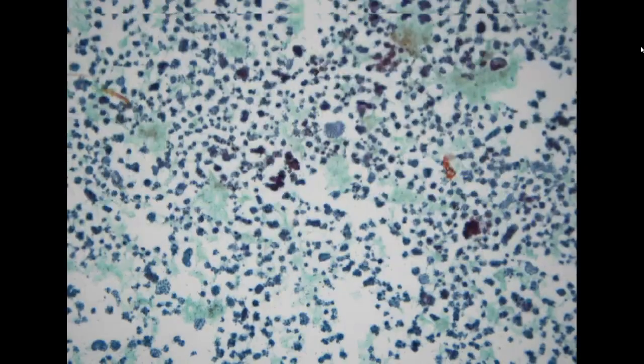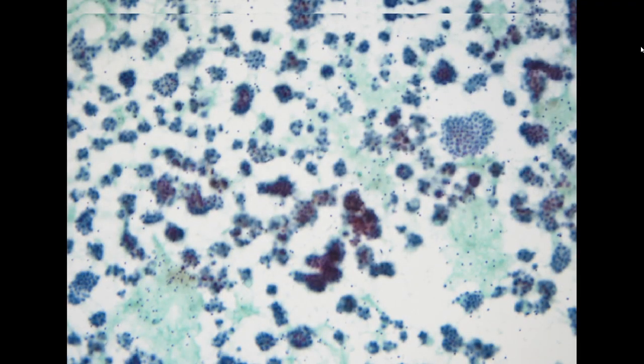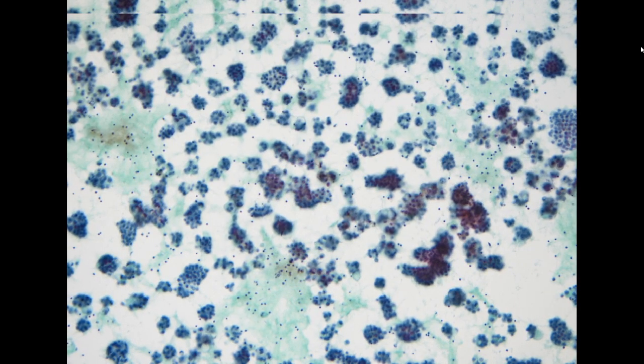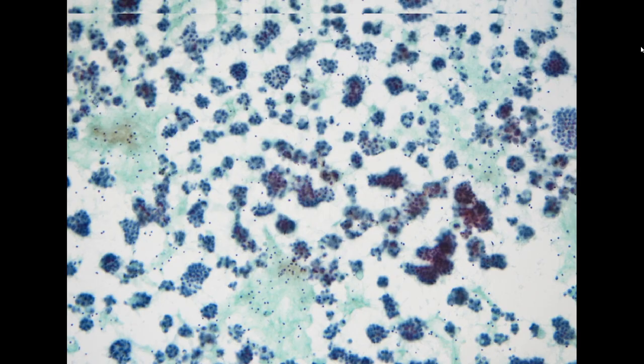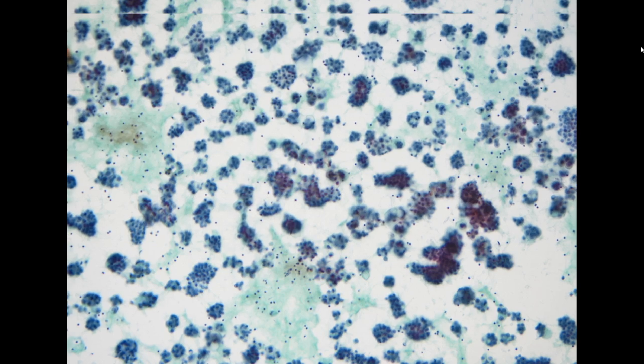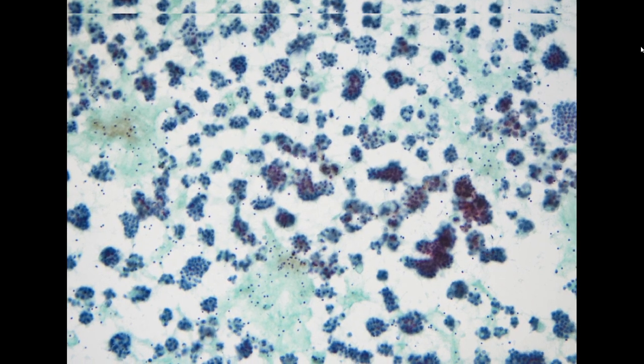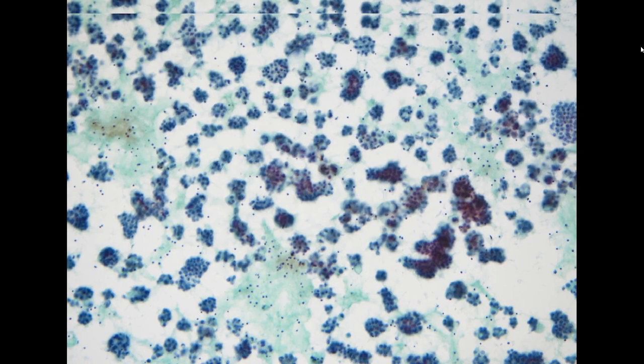So the next specimen, the patient is a 64-year-old female. This is a pleural effusion specimen, and the patient came to our emergency department. She is actually a new patient here. She only came to our hospital once and seems to have had a consult with a famous breast surgeon for a second opinion. So she has breast cancer and apparently advanced disease. So the clinician sent her to the ER, just to get her admitted to the hospital. So this is her very first specimen of the pleural effusion.